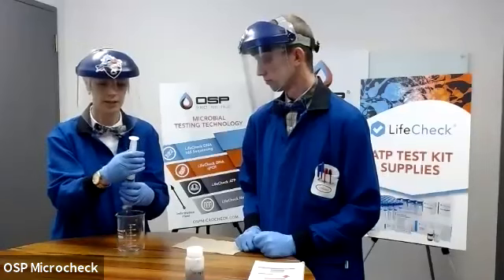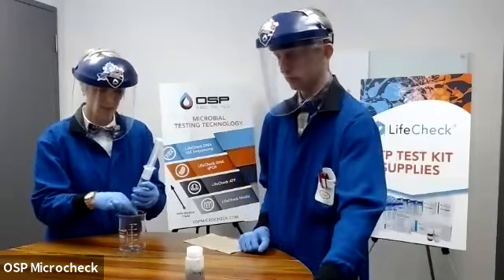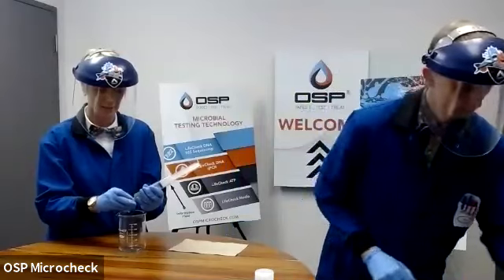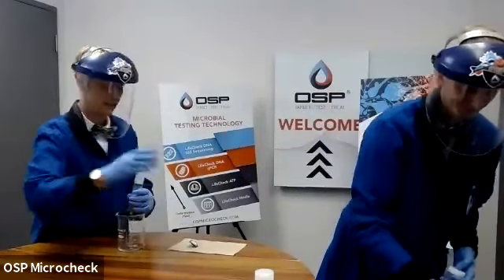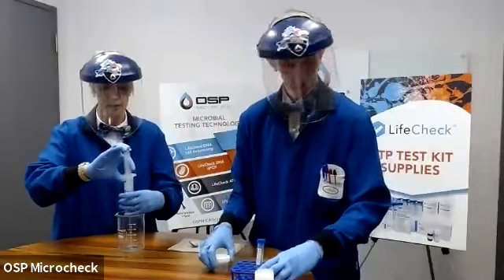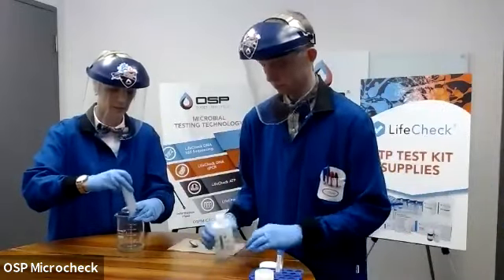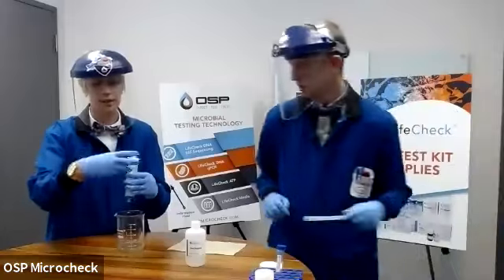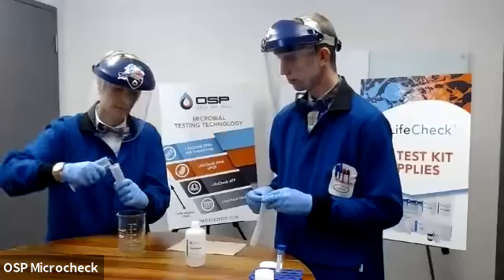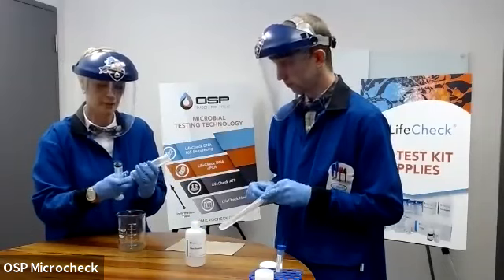Because I push so hard, I do back it off just slightly so that when I take the filter off, I'm not going to get splashed. Again, hold it over my waste receptacle so I can pull that off. Ooh, success. Now you can either try to push the rest of it through if it's not too much blocked, or you're going to want to take the plunger out so that you can empty the syringe, because we're going to continue using it while we push different reagents through that filter. All right. Again, don't put the filter back on until we pull this plunger out. Place the filter right back on. And we're ready for the next step.